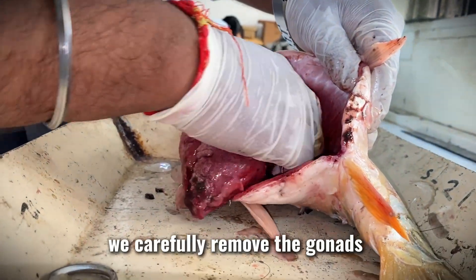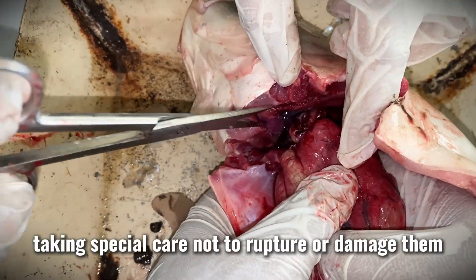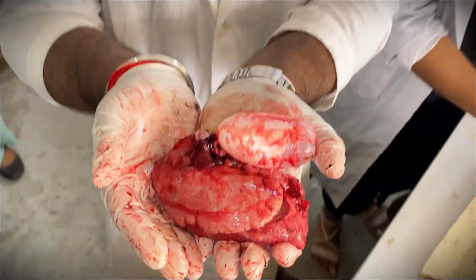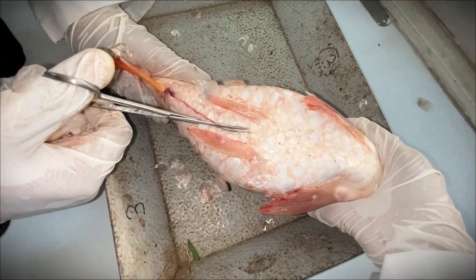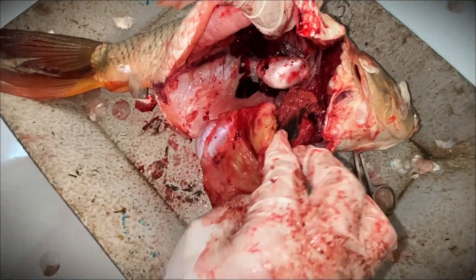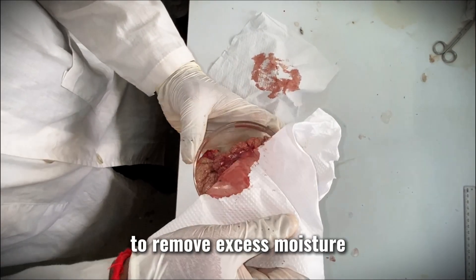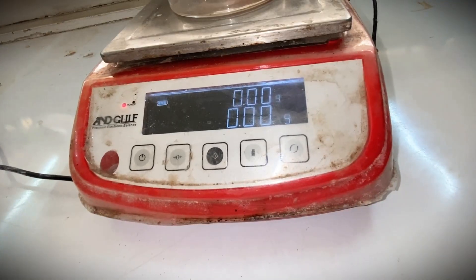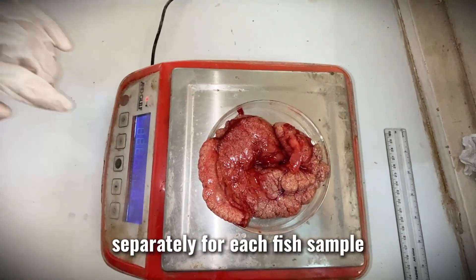From inside the cavity, we carefully removed the gonads and gut contents like livers, taking special care not to rupture or damage them for both samples. Gentle handling is crucial to preserve their integrity. After removal, the gonads and livers are gently blotted with tissue paper to remove excess moisture and kept in a cleaned petri dish. We then recorded the weight of the gonads or ovaries separately for each fish sample.